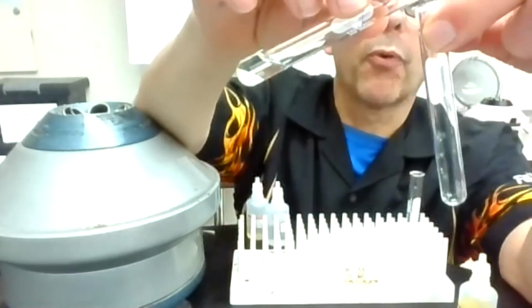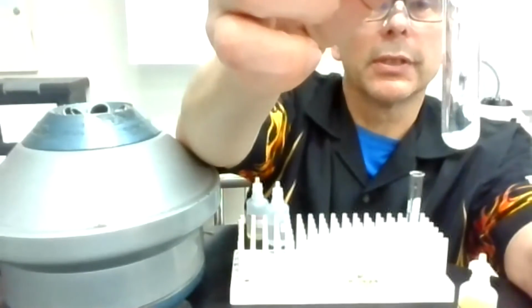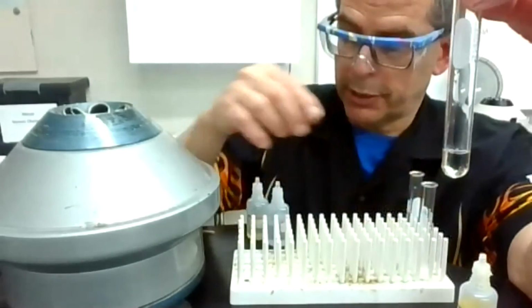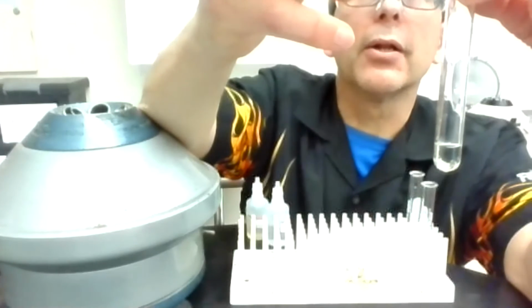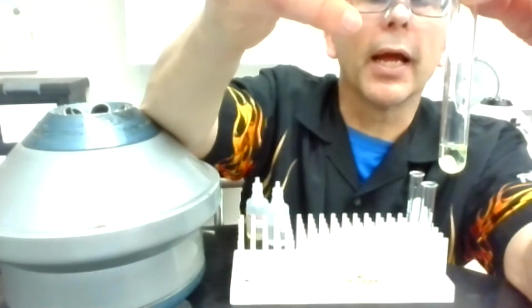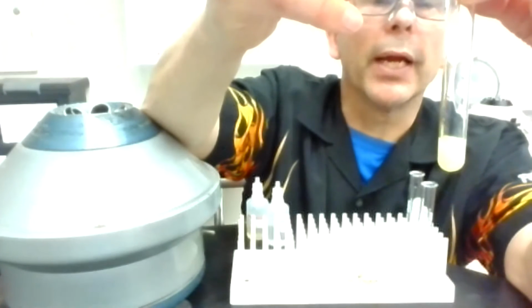All right, so I'm going to pour the liquid into one test tube. So there's the solid left behind. Here's the liquid, or solution, I should say. And then I'm going to do my last step and add CrO4 minus 2. And again, look right away as I add that. Is it getting cloudy as I add the drops? That is probably the biggest way to tell.